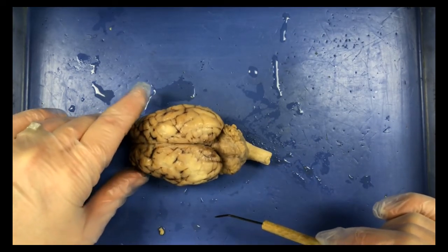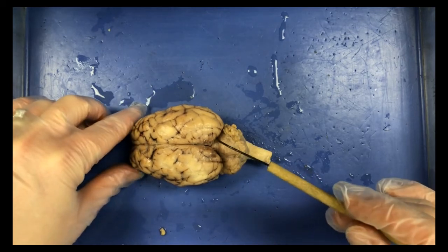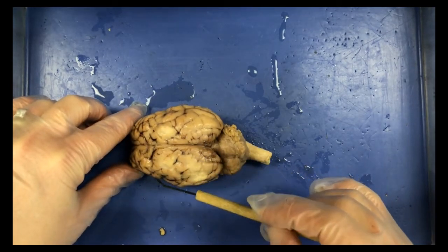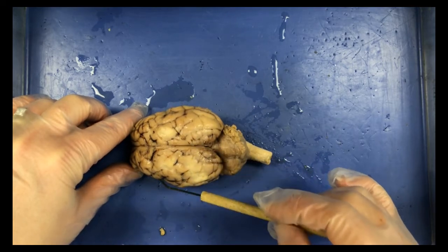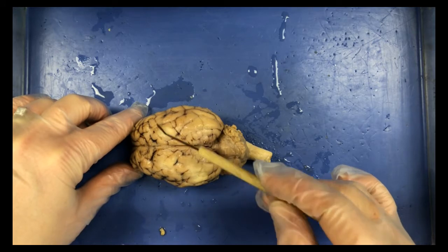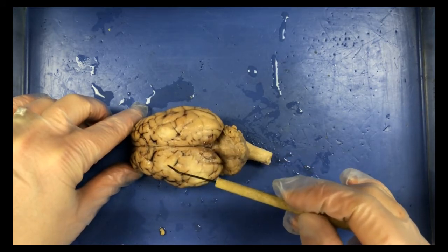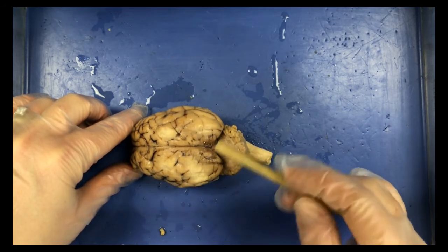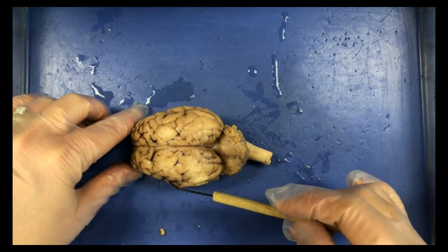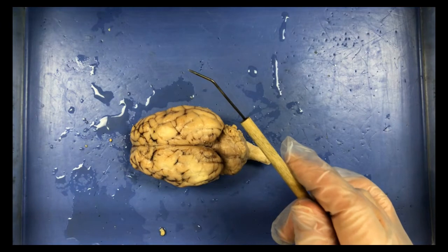And then we can also identify the sensory and motor cortexes. So remember, the motor cortex is in the frontal lobe. It's the last section of the frontal lobe, so it's going to be right across here on our brain. And then that's the motor cortex, and then the sensory cortex would be behind it, and that's the first part of the parietal lobe. So motor cortex is in your frontal lobe, sensory cortex would be in the parietal lobe. So all of those different structures from our superior view.